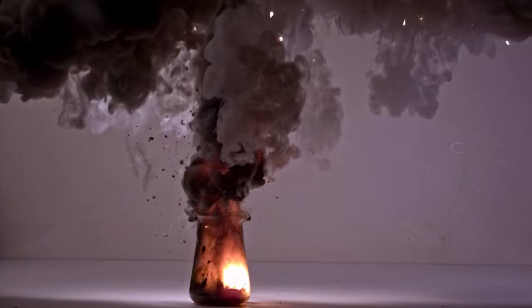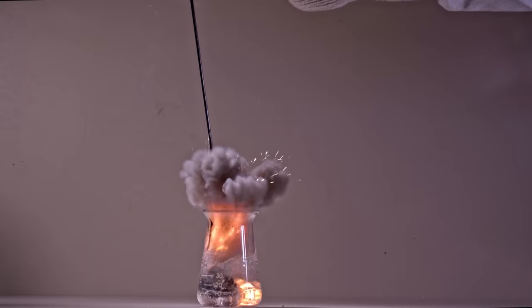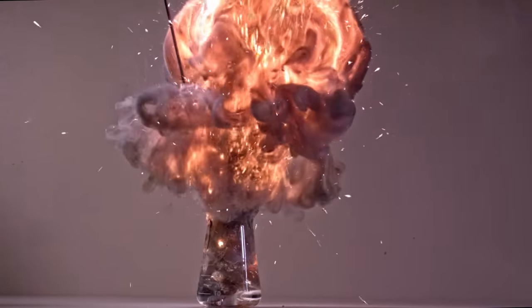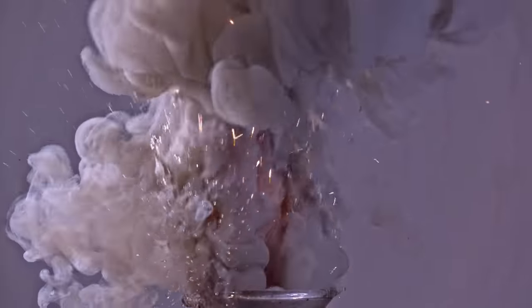Hey guys, I already showed you the reactions of burning magnesium with carbon tetrachloride, chloroform and dichloromethane. So in this video I decided to find out what happens if we replace chlorine with iodine in these reagents.